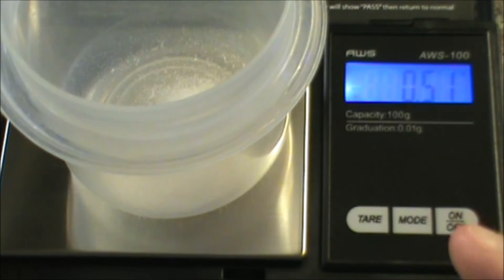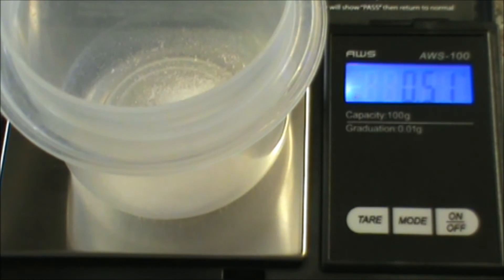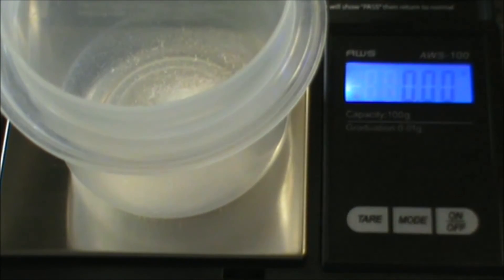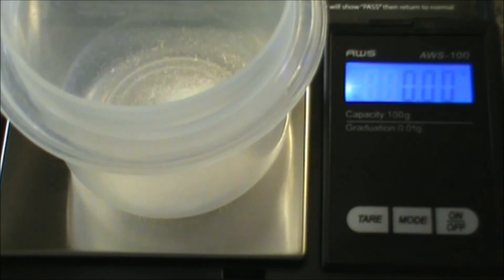And then if I want to add something else to my little container, if I'm mixing many supplements together that I have in powders, I'm going to hit tare again and it's going to re-zero it out so I can just continue to add my supplements on top in the same container.